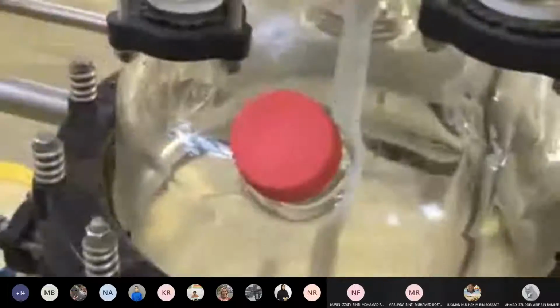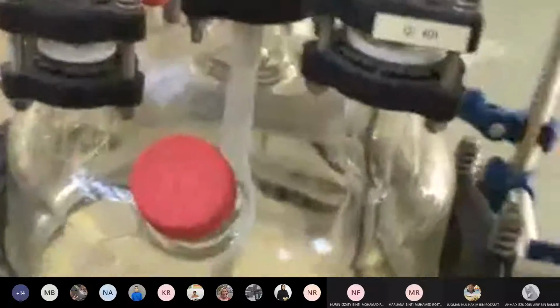Okay, right. Then we have learned that in a reaction, concentration will decrease with time, because sodium hydroxide will be consumed during the reaction. It will react to produce products, so of course the concentration of sodium hydroxide will decrease. So how do we monitor or record this concentration of sodium hydroxide? We use conductivity. Okay, so how do we use it?